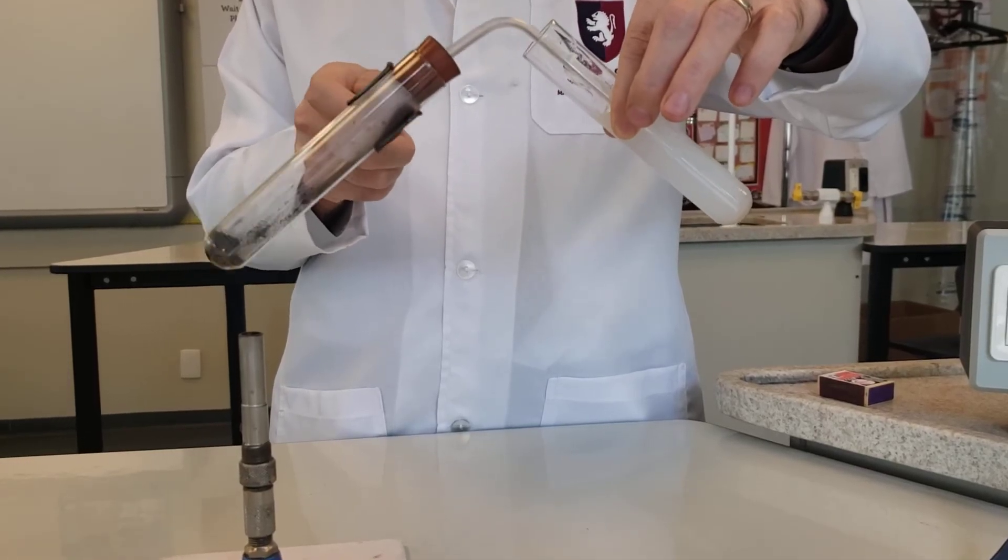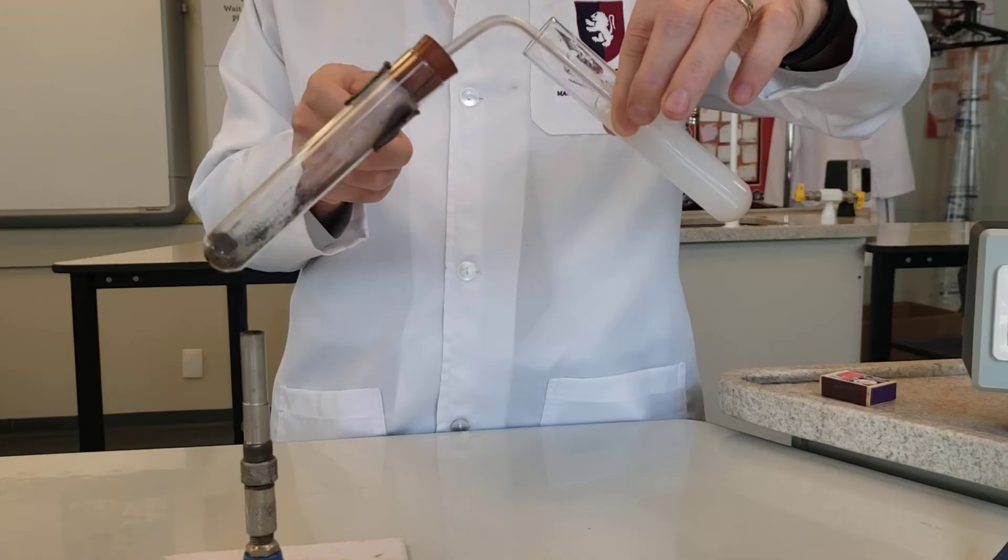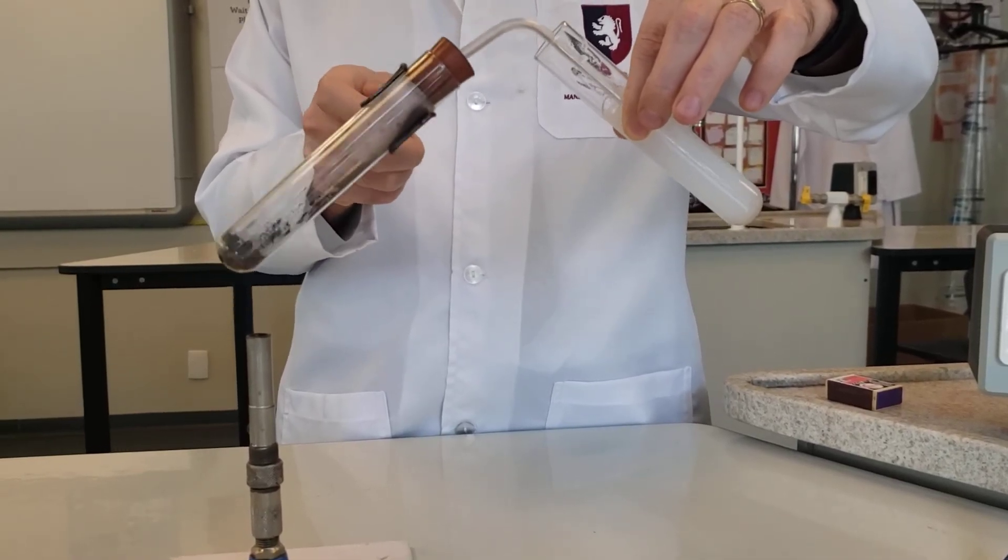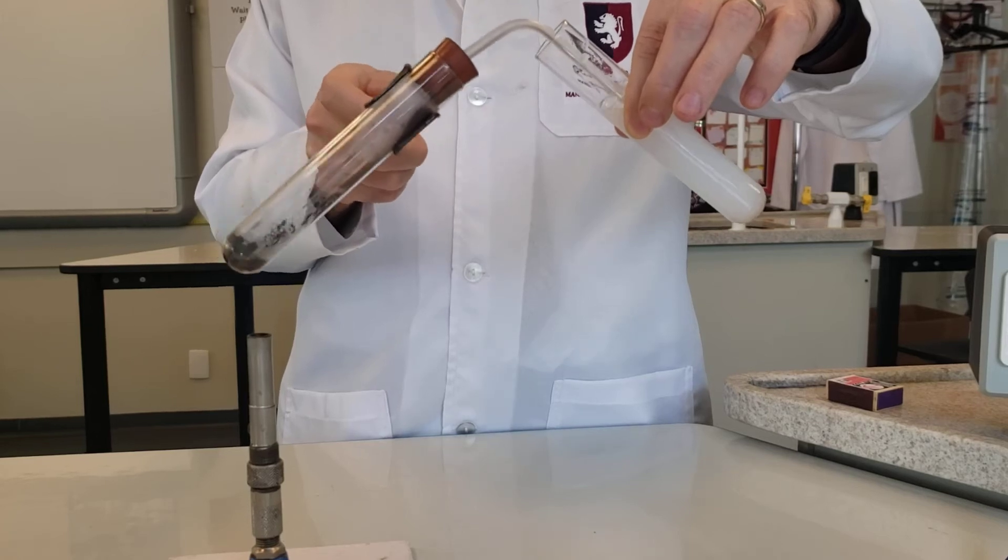So it's a very low heat required for this thermal decomposition. Much lower than when we did calcium carbonate. And there we are.